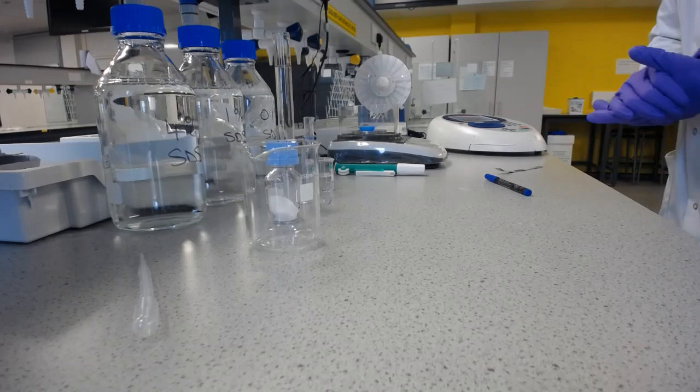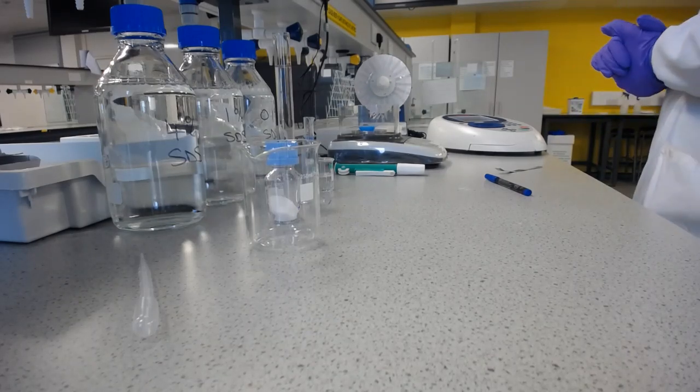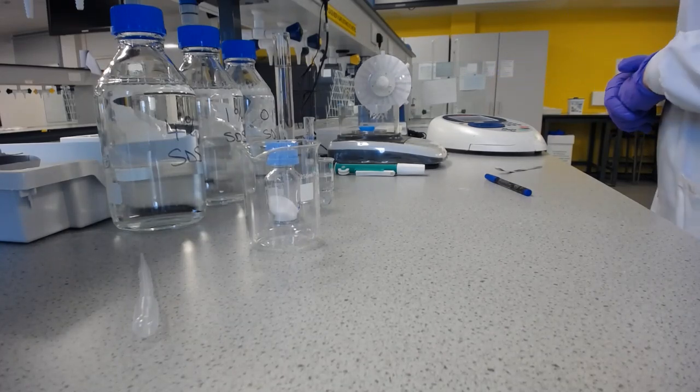Now what you didn't see me do is that I labelled all of those so I knew which one was which when I took them off, because if I didn't, I'd have to start again because I probably wouldn't be able to tell the difference between the 3 of them.